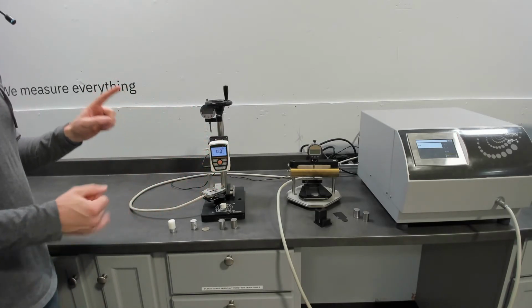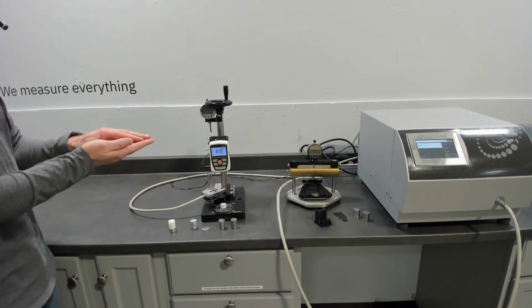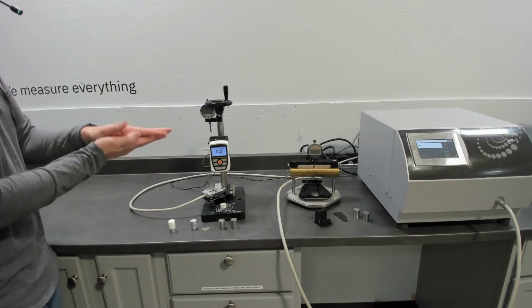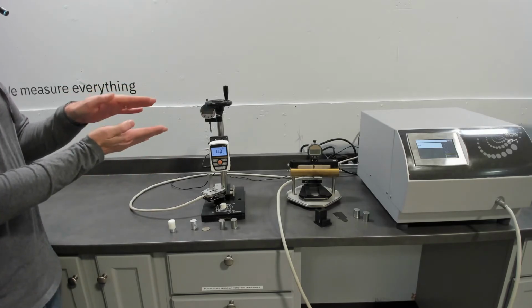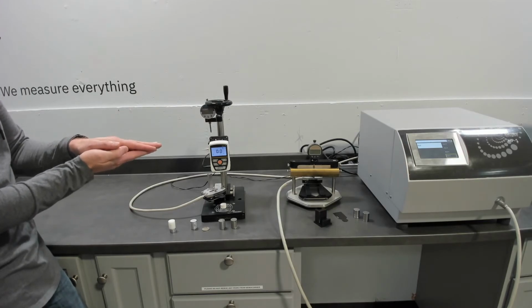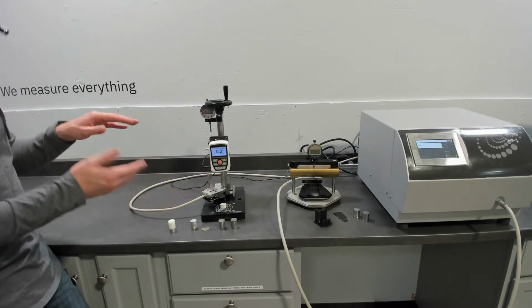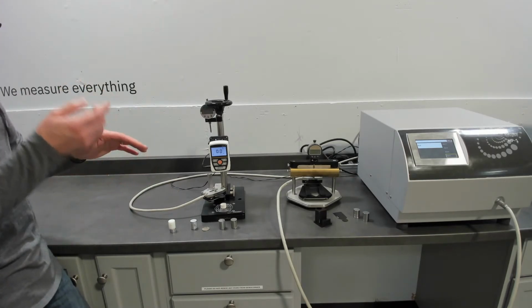And of course, contact resistance, in this case we don't have to introduce a material, so we can measure the dry contact resistance between 2 materials. So you can measure introduced materials and get the resistance of those and calculate the intrinsic thermal conductivity of that introduced material in these applied setups, or you can measure the effective value of 1 layer.